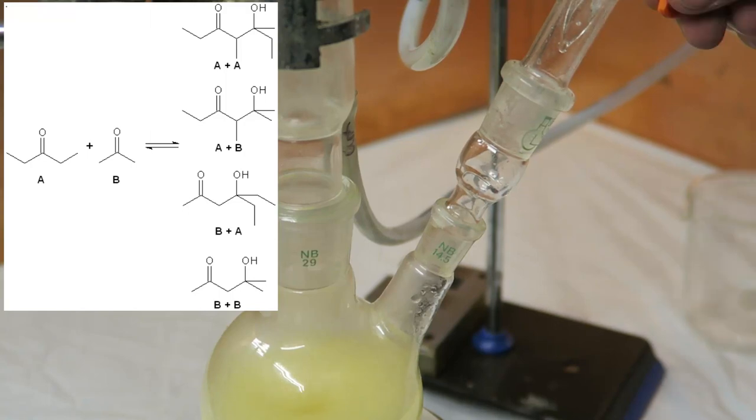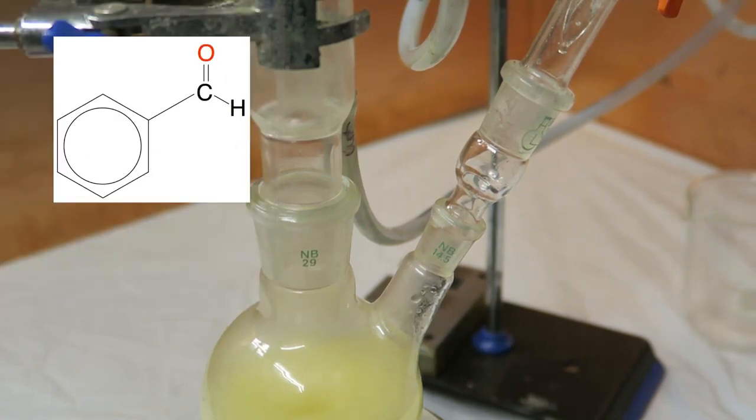In our case, however, only acetaldehyde can act as a nucleophile, because benzaldehyde does not have an acidic alpha-carbon. Also, to restrict the aldol reaction of acetaldehyde with itself, we're dripping it into an excess of benzaldehyde.